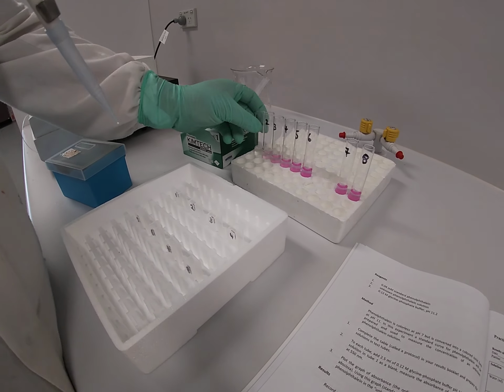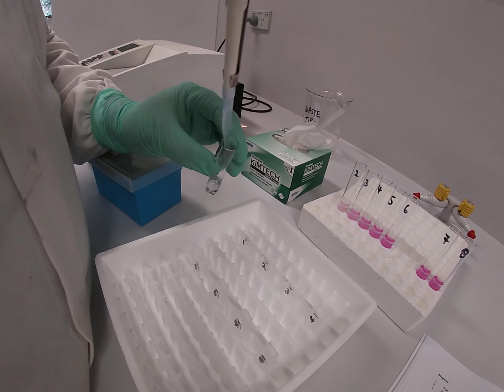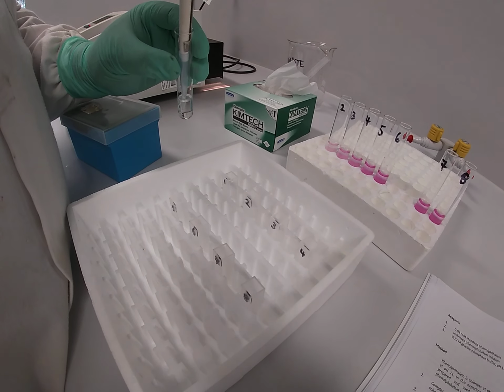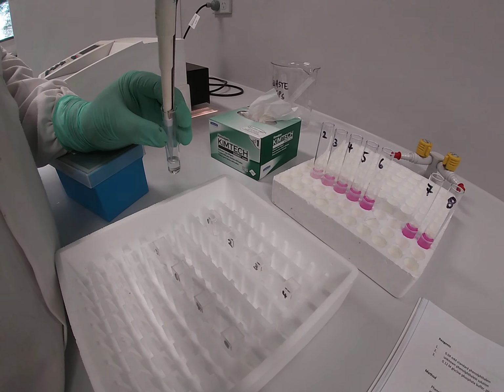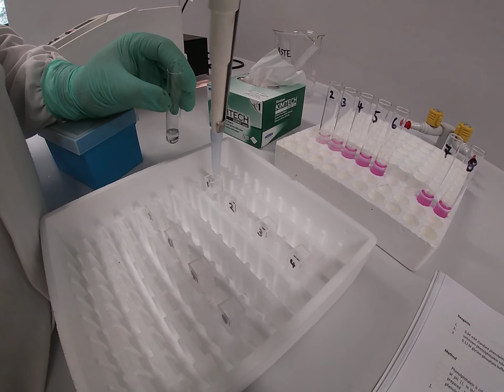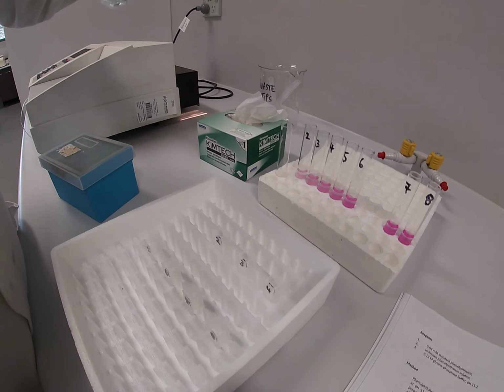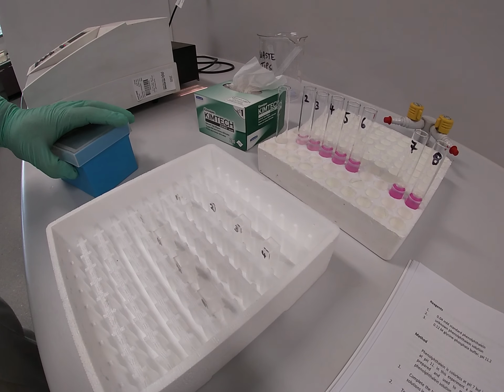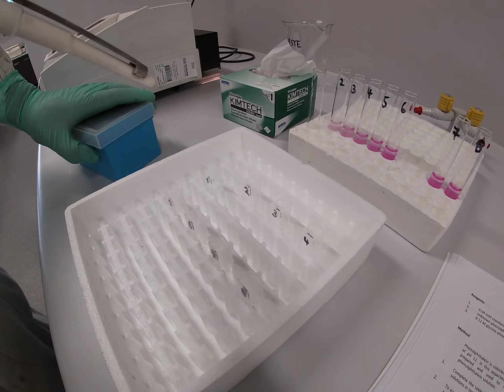What we do is we take our solution and we transfer approximately 2 mils to each cuvette. In this case it would actually be 3 mils. And what we need to do is ensure that we've got enough solution there to allow the light to actually pass through and measure an absorbance reading. And just good standard practice is, every time you fill up one of your cuvettes, to then put it in a different row with the others.